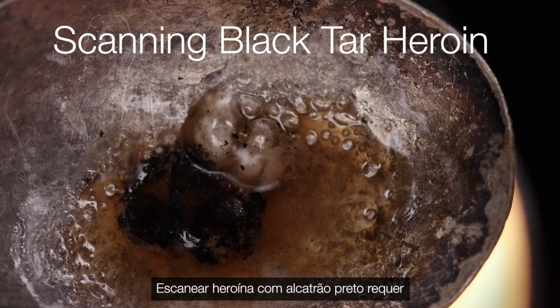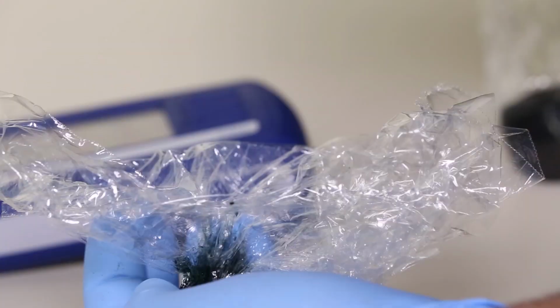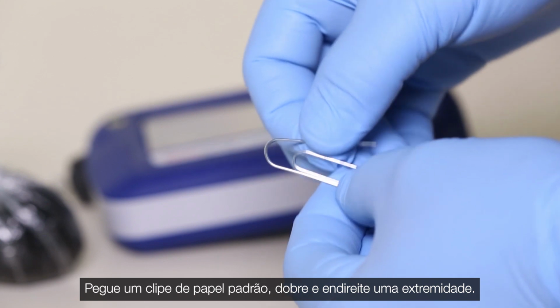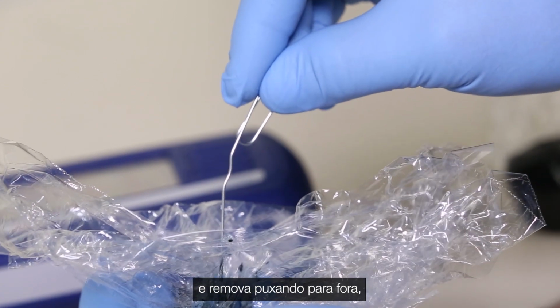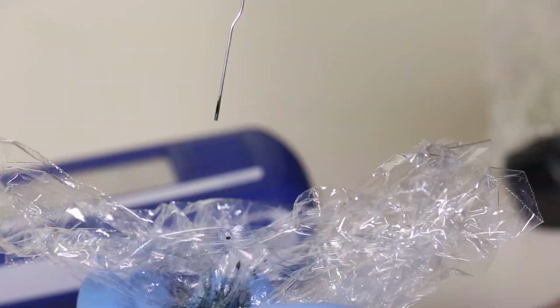Scanning black tar heroin requires a few modifications to the procedure during sample extraction. Open the bag or container containing the substance so it can be sampled directly. Using a standard paperclip, unbend and straighten one end. Insert the paperclip straight into the substance and remove by pulling straight out, removing a minimal amount of the sticky substance on the end of the paperclip.